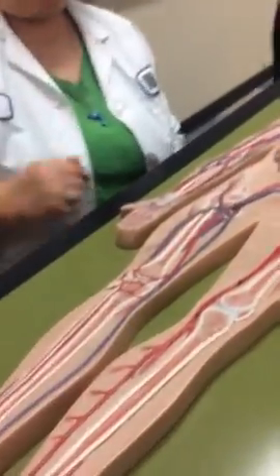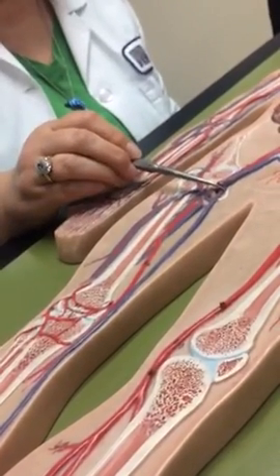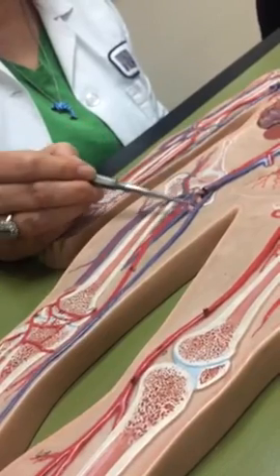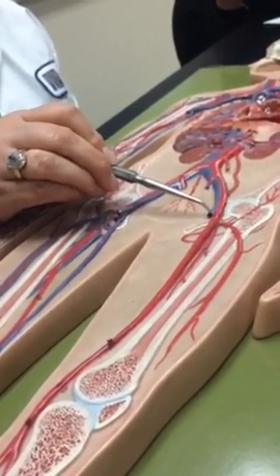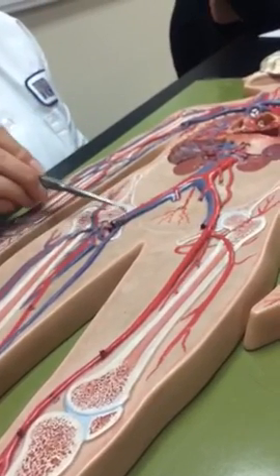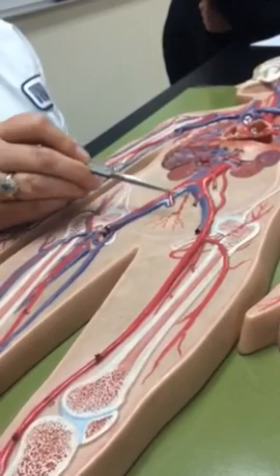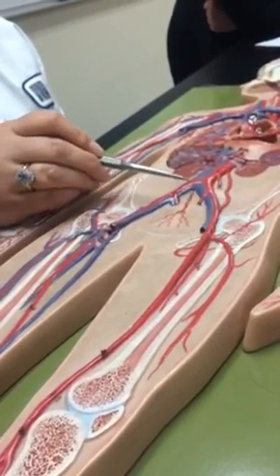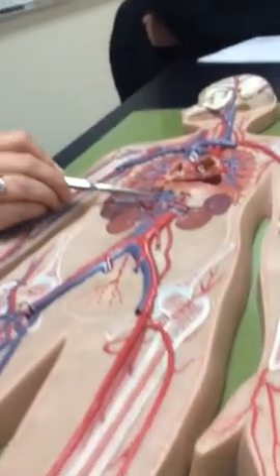And then the right or left femoral vein. So as soon as you get up here, this is part of the femoral, and then they pick it up again here because the saphenous goes into it from underneath. And you've got a little bitty piece of it over there on the left. So a little bit of right. Then you go into the external iliacs, then your short little internal, right where the arteries were, and then the common again, right where the arteries are. And then you go into the inferior vena cava.